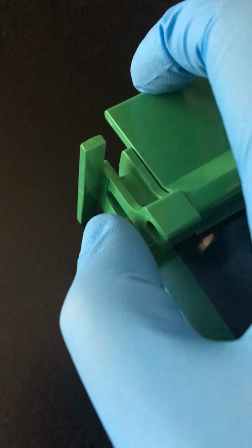So then I usually take this, and you want to make sure that this is kind of flush. It's kind of hard to see on the camera, but I just make sure that the bottom of the two plates are lined up.